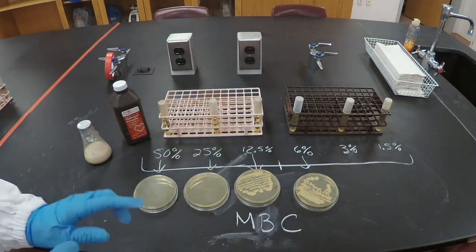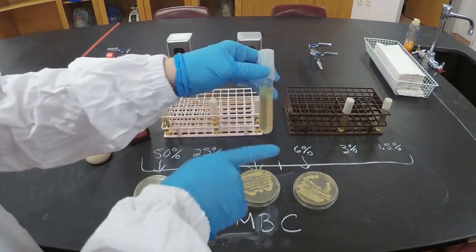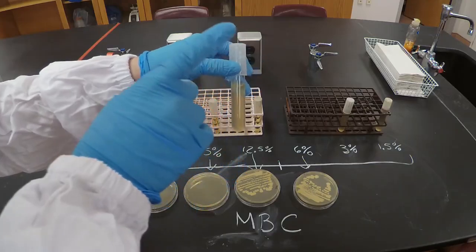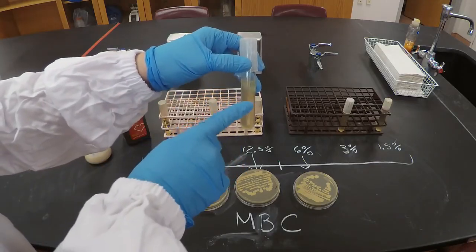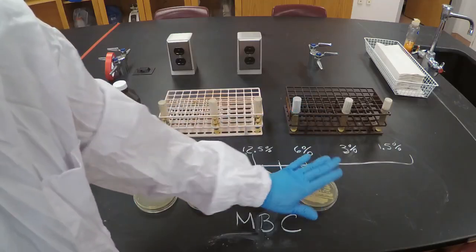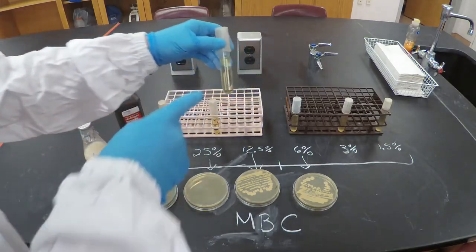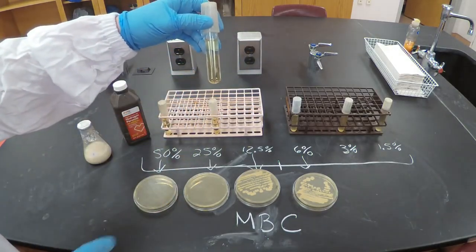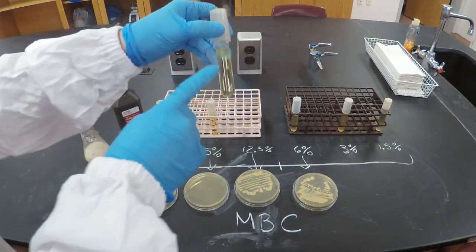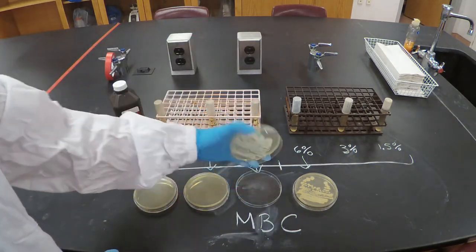This was my positive control, because I knew that the bacteria were still dividing, were still growing. So definitely, if they were still growing, that means that there must be alive cells in this tube. And indeed, when I plated, I got growth. So this is my positive control, and actually I got it right. Good. Interesting now, the 12.5% of hydrogen peroxide that inhibited the bacterial growth didn't kill the cells. So there are some cells still alive in this tube. And when I plated the 100 microliters, they're still alive.